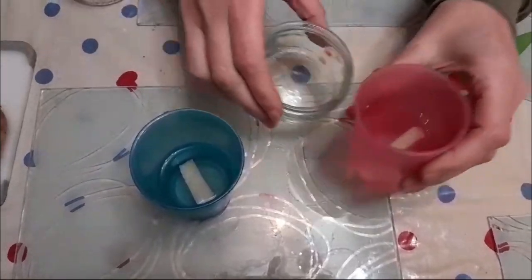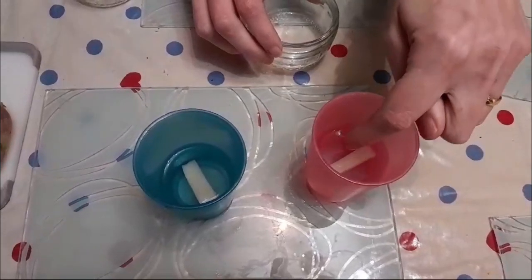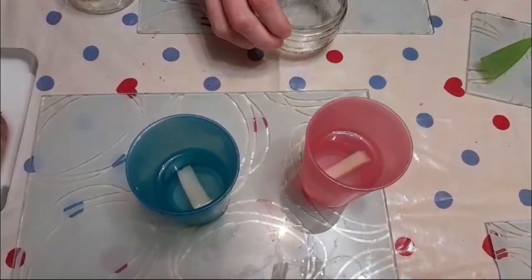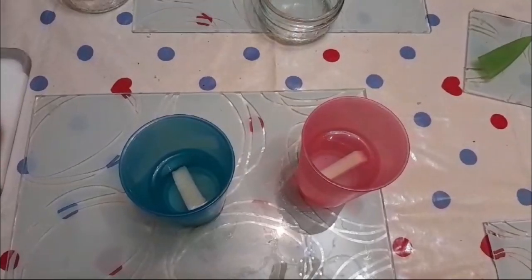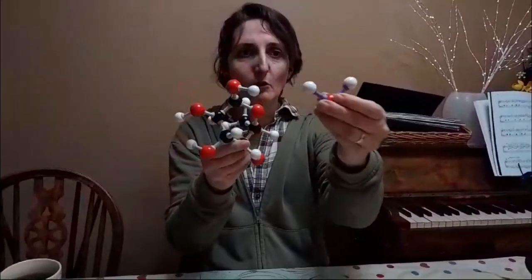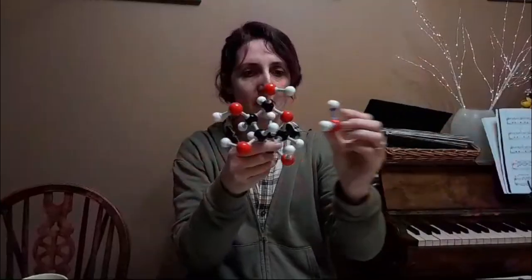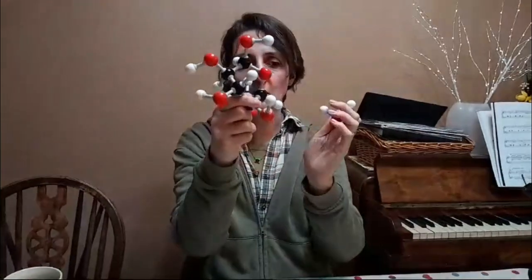So let's try our hypertonic one first. What we had with this one was more sugar in the water than we did in the potato. And we've got that semi-permeable membrane, that tea bag, it's got to go through. Now, before we take a look at it, let's just look at this. Here's a molecule of sugar, yeah? It's pretty big. Here's a molecule of water. That's pretty small. This can pass through a membrane, but my sugar is going to get stuck. So that means I can't have the sugar moving into the potato. The water should have moved out of the potato.